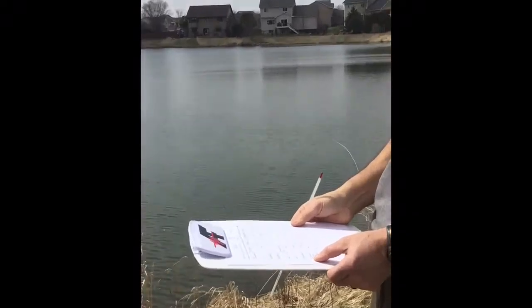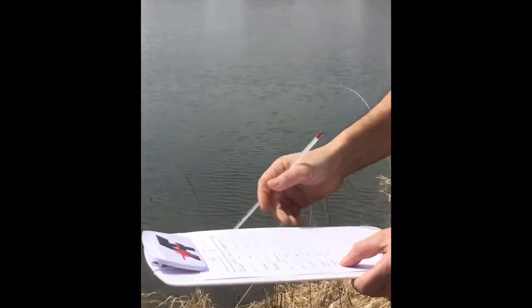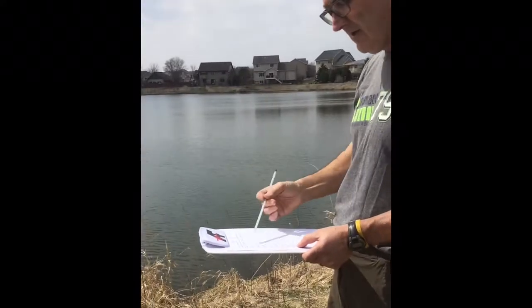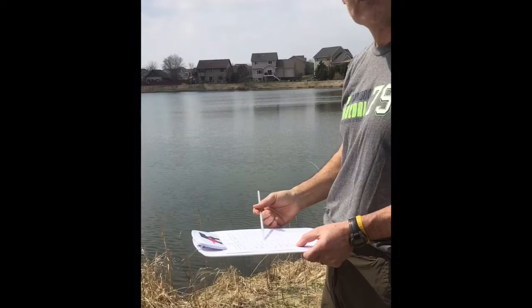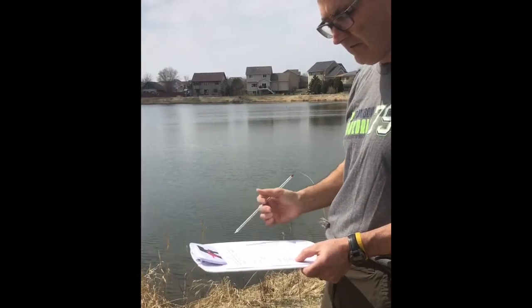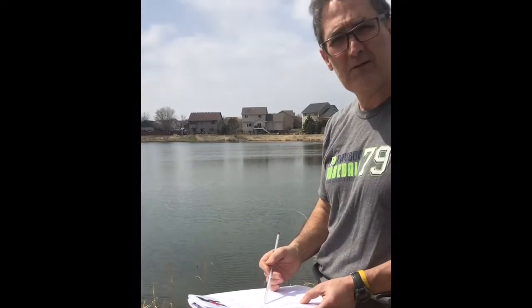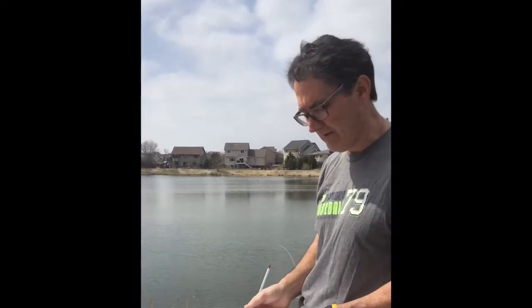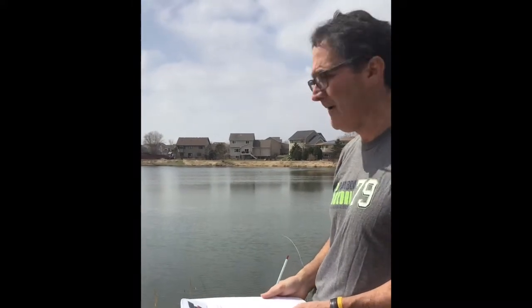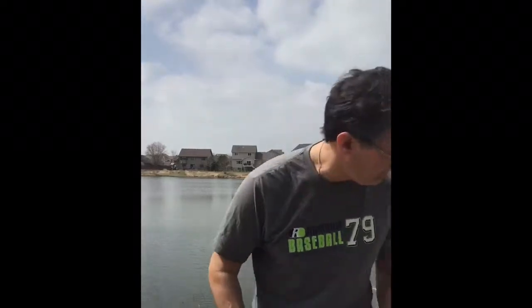nitrate, phosphates, total dissolved solids, and total suspended solids. Some of these I'll do right on the site here, and others I'm going to take the water sample back to the high school and we'll do the test there. My wife already said she didn't want fecal coliform growing in her kitchen, so we'll take that back to the high school. But I do want to do a dissolved oxygen test for you, so for that I'm going to go down to the edge of the pond.